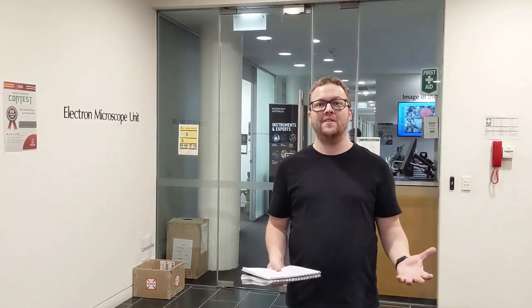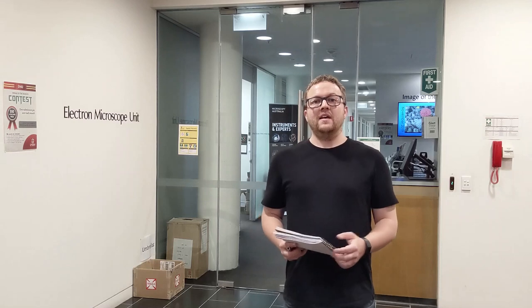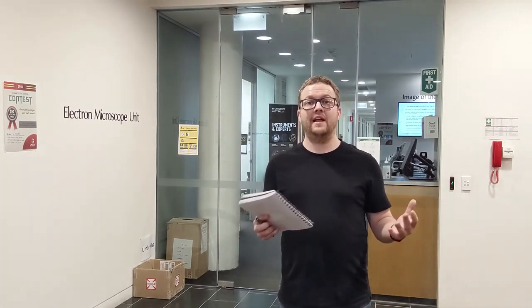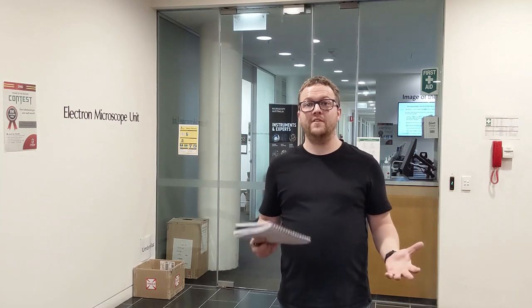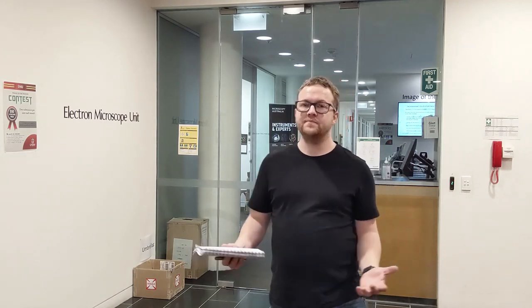Hello and welcome to the Electron Microscope Unit. My name is Richard Webster. The Electron Microscope Unit is in the basement of the Chemical Sciences Building and we provide electron microscope facilities and expertise to researchers across the university, from honours level students to professors.